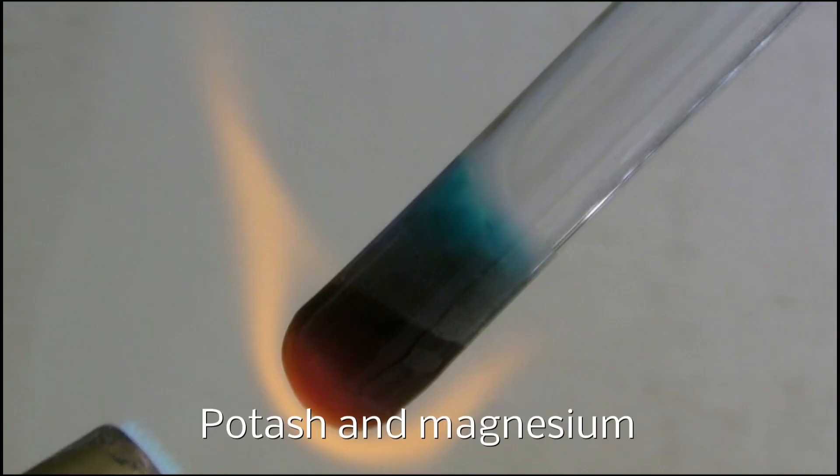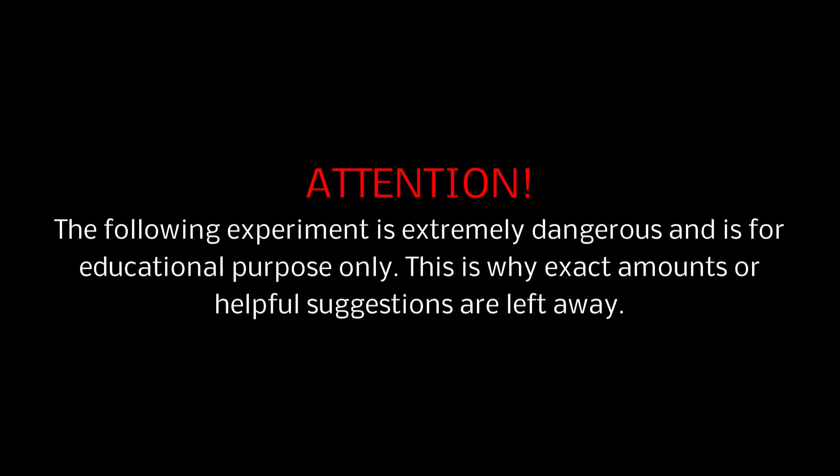Potash and Magnesium. Attention! The following experiment is extremely dangerous and is for educational purpose only. This is why exact amounts or helpful suggestions are left away.